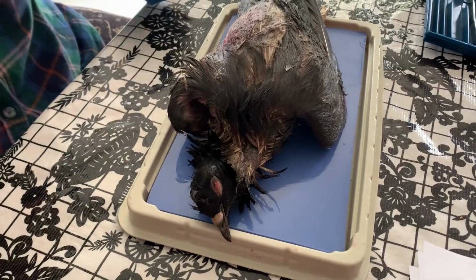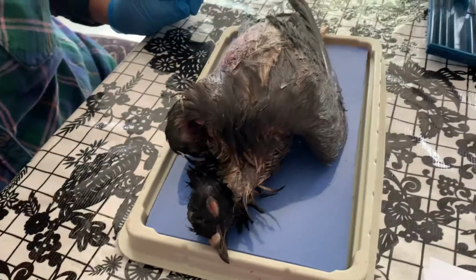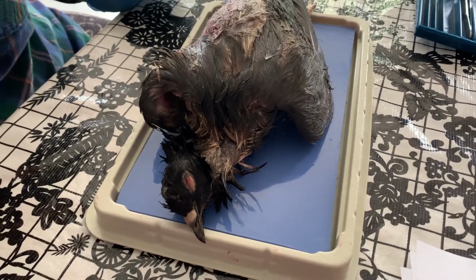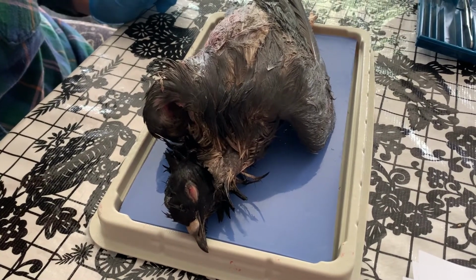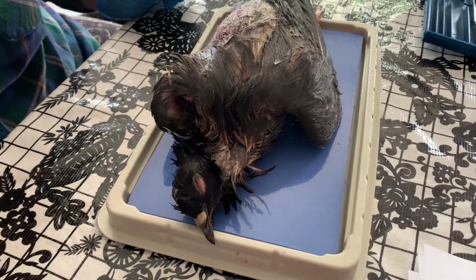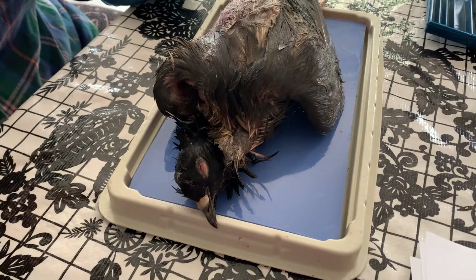Right, this week we get to do pigeons. Woo! These are lovely. Actually, we're doing extant dinosaurs, guys. I know that sounds kind of funny, but a lot of the things that were present in late dinosaurs are characteristics that carried on to modern day birds.